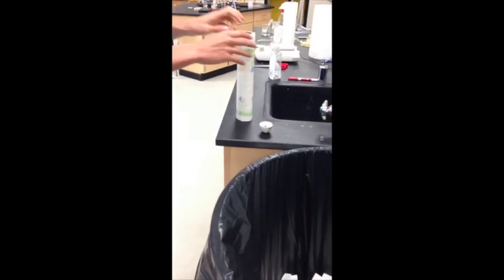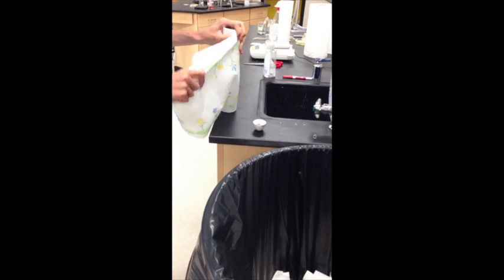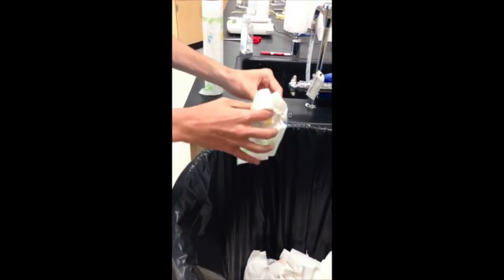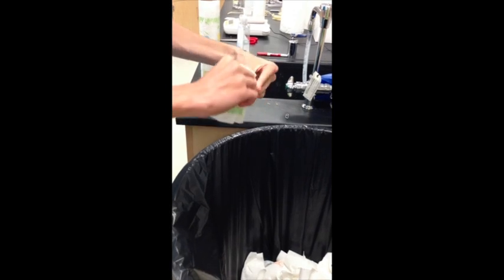Do not wash the crucible with water. Take a dry paper towel and clean the inside. The hydrate and the paper towel may go in the trash when you're done.